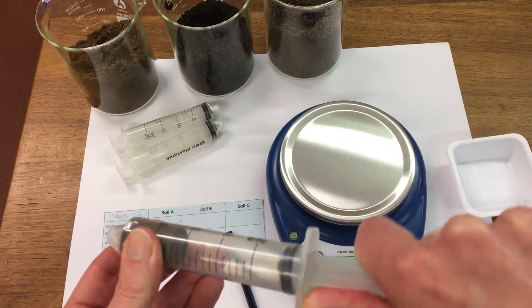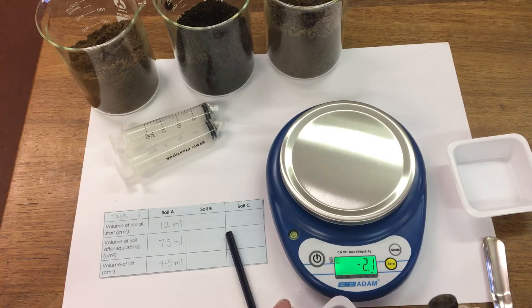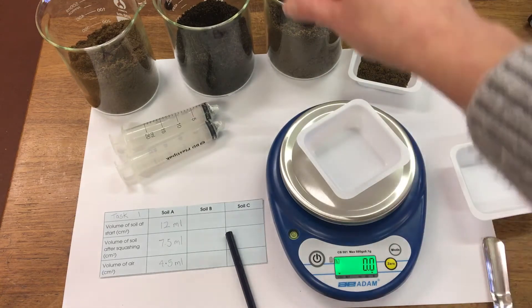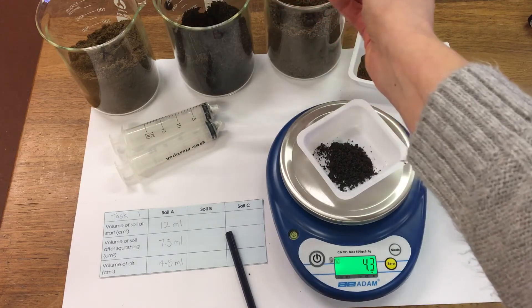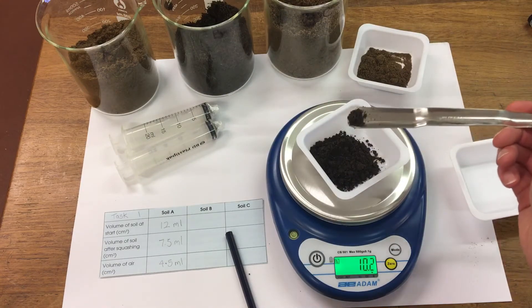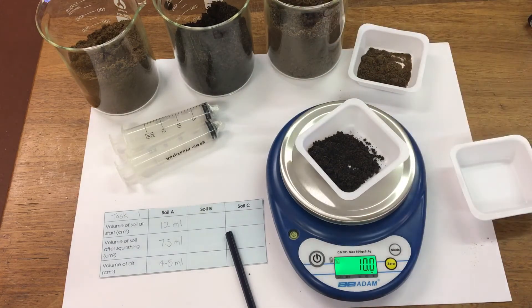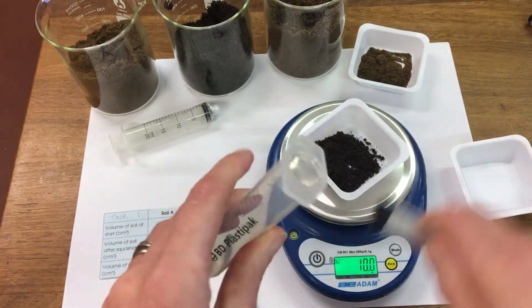I'm then going to pop our 10 grams back into the weighboat. Then for soil sample B, we're going to do exactly the same — we've got exactly 10 grams of soil B and we're going to transfer it into a syringe and find out the volume of air.